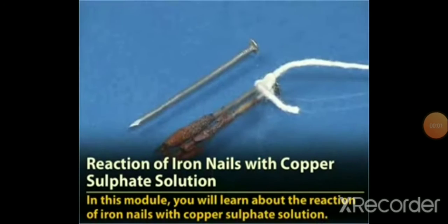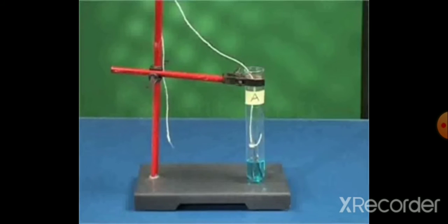Let us see now. This is the third part of this experiment number 3. In this module, we will learn about the reaction of iron nails with copper sulfate solution. When the iron nails are kept in copper sulfate solution, the copper sulfate solution changes its color. Let us see this change.